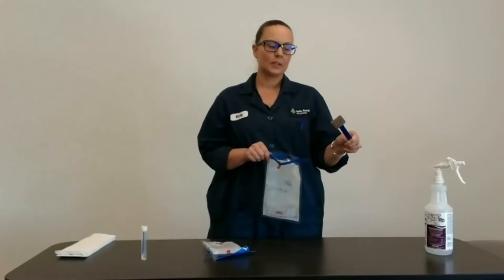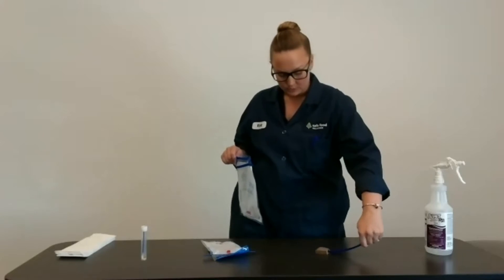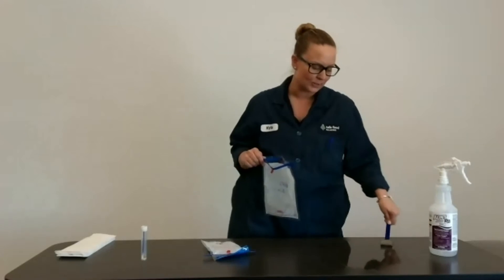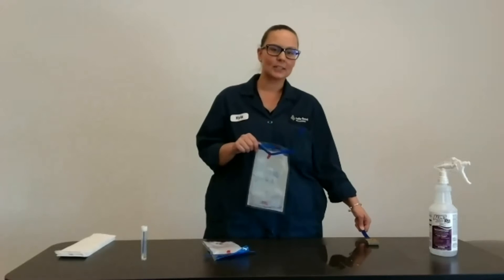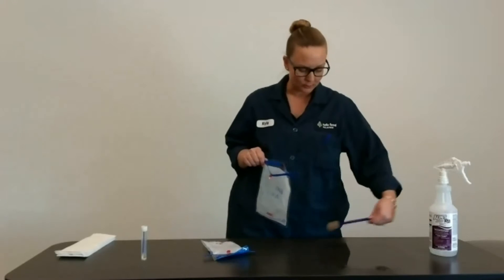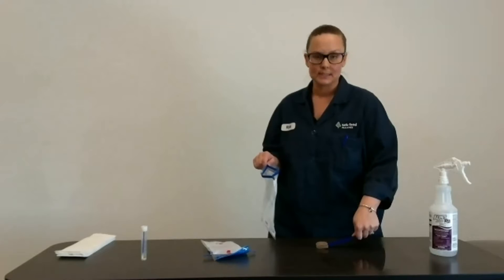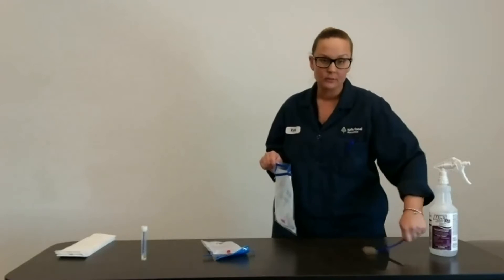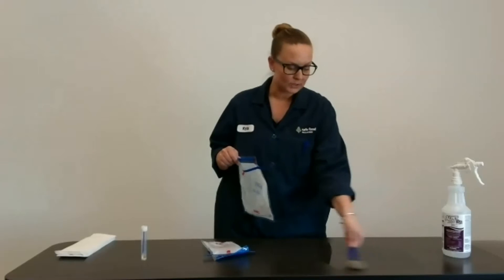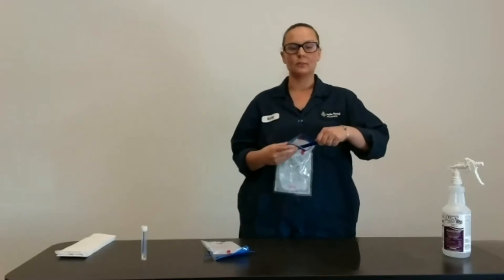You want to utilize the entire surface of your sponge. Best practice for swabbing: put a little bit of pressure on and go back and forth — no more than about a foot squared, depending on the surface or sample size, though you can definitely do more. Rotate your swab, put the surface of the sponge to the surface you're sampling, push down a little, go back and forth comprehensively, then flip it 90 degrees. Flip your sponge over and sample back across what you just sampled to get a comprehensive sample of the area.